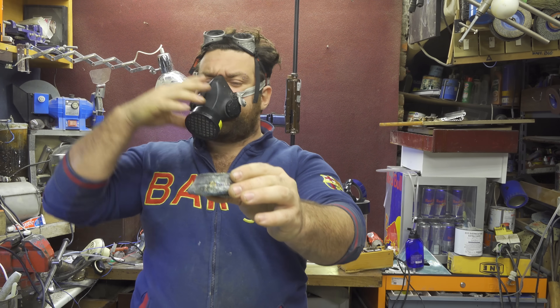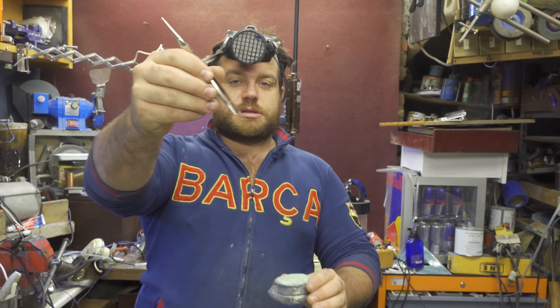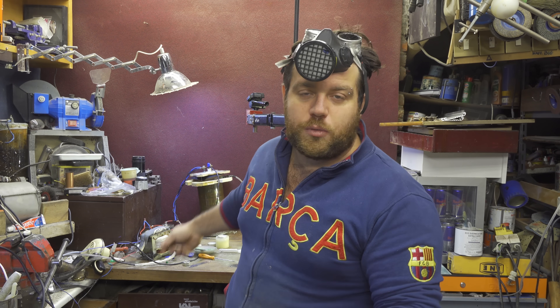So I'm quite happy. Here are all the rubies — I have more set aside, but these are the ones, a little bit small. The biggest one was almost one centimeter. I tried to pick it up with my tongs but I have big fingers and I'm not used to such precise work — when I went to grab it, it just skipped away. I lost it somewhere on the table between the boards — it was a very sad experience.